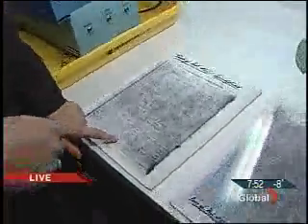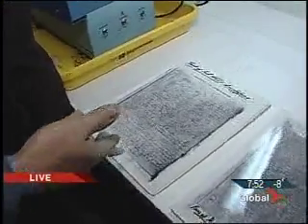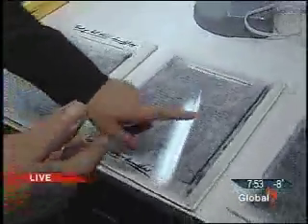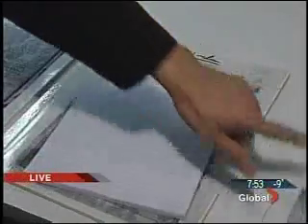Now here, the first sheet underneath the original, we have indentations showing that there was a suicide letter left behind, and as we go down to the subsequent layers of pages, we can still bring up the meaningful indentations off the paper pad. Even if you go down to like here, you're still going to get some indentations and end up with something like that. This was the original suicide note? That's exactly what we have.